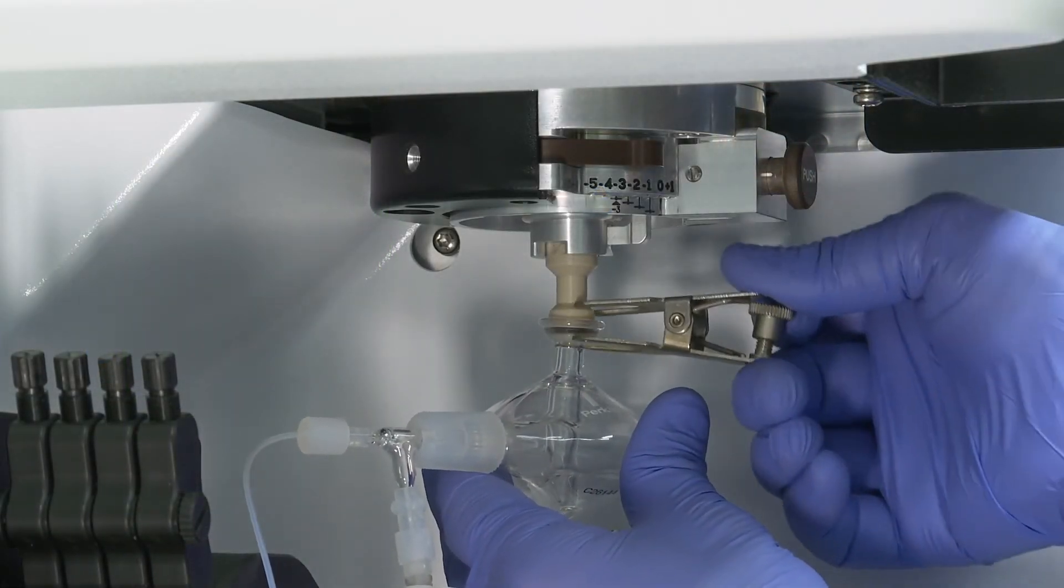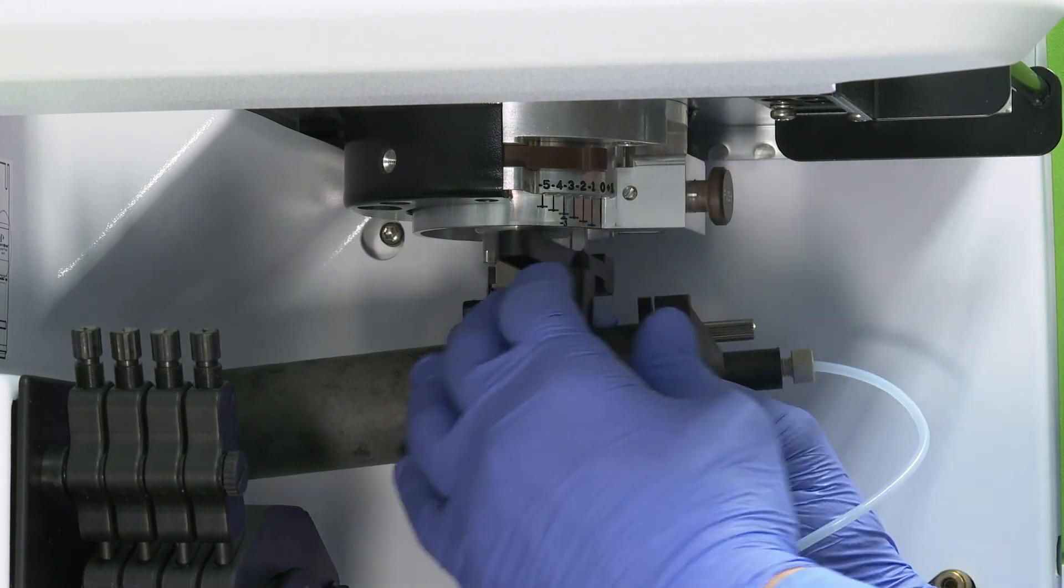Next we will reinstall the spray chamber assembly into the injector.